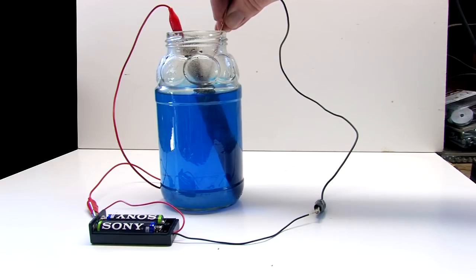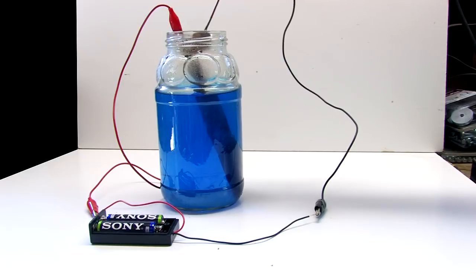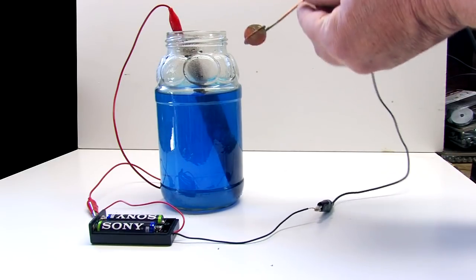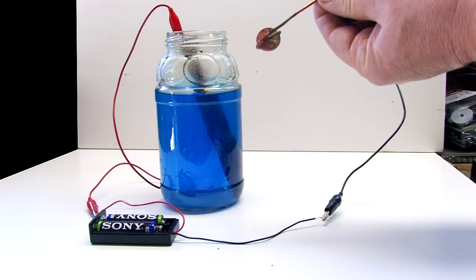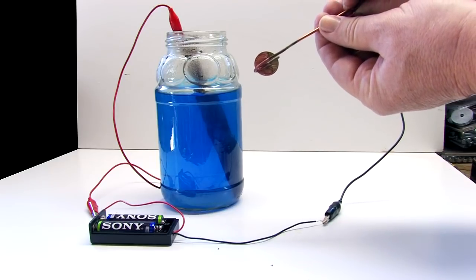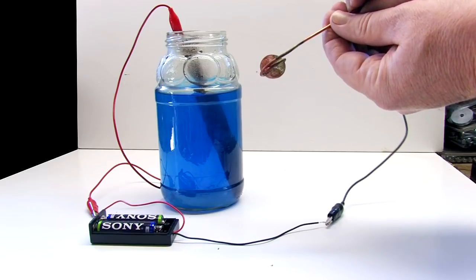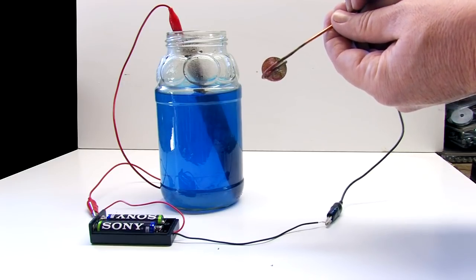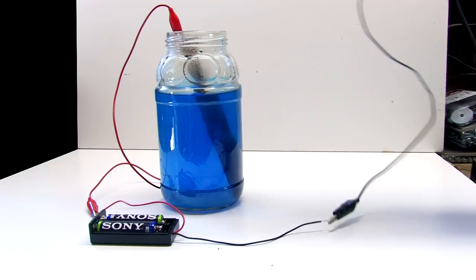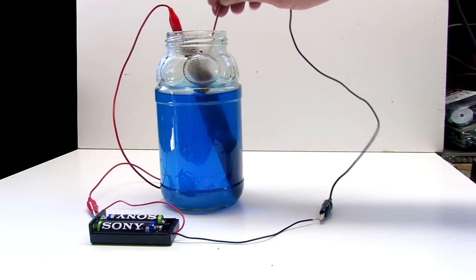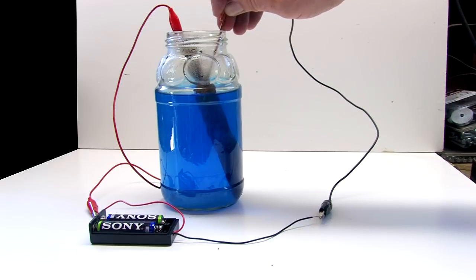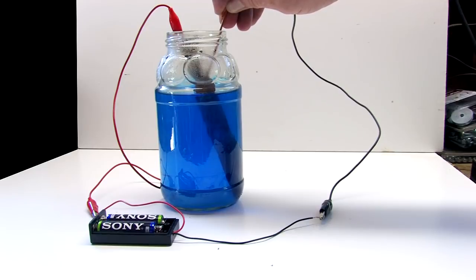So I'm pretty excited. Does copper sulfate pentahydrate, nine dollars for a couple of pounds, will it do a copper plate just like regular copper sulfate will? I'll have to look up the MSDS as well on this substance and make sure there aren't any additional dangers before I post the video. I'm excited and I'm really hoping when I pull this out we'll see that a copper plate is beginning to take place. And look at that, the side that's facing the copper pipe there has naturally picked up the copper first, so I'll go ahead and shut the camera off.